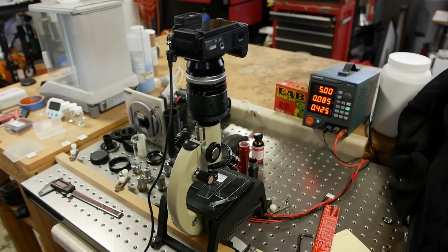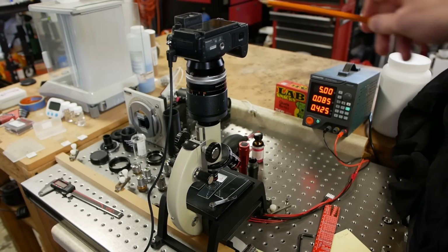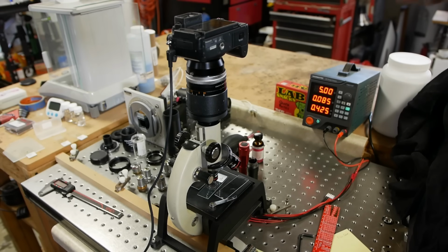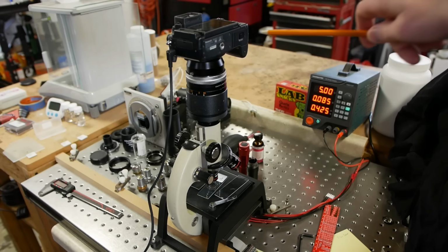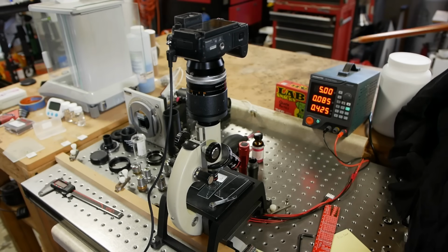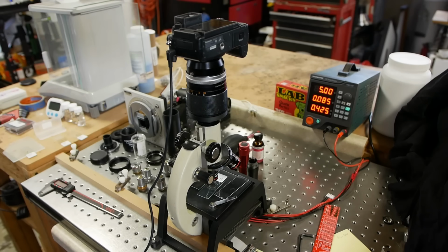I acquired all of the images using a Lumix G85, which is actually what you're looking through right now. This is a GH1 just standing in for it. But as we'll find out, this is actually a big problem. The issue is that there's a color filter in this camera, and that poses a really big problem for reconstructing these images, which we'll get to later. So if you're going to attempt to try this technique out for yourself, you've got to get a monochrome camera, something that doesn't have a color filter array, which is actually not so easy these days.